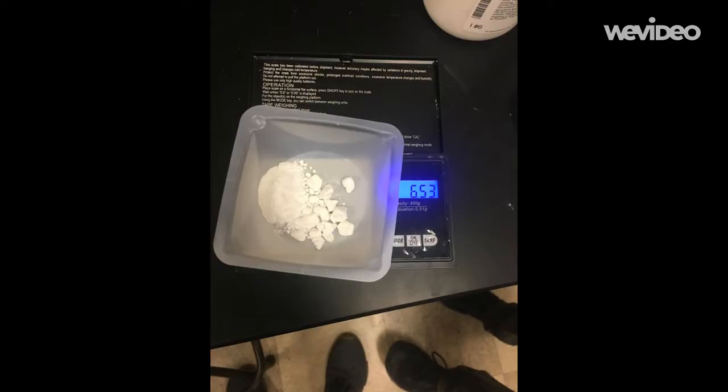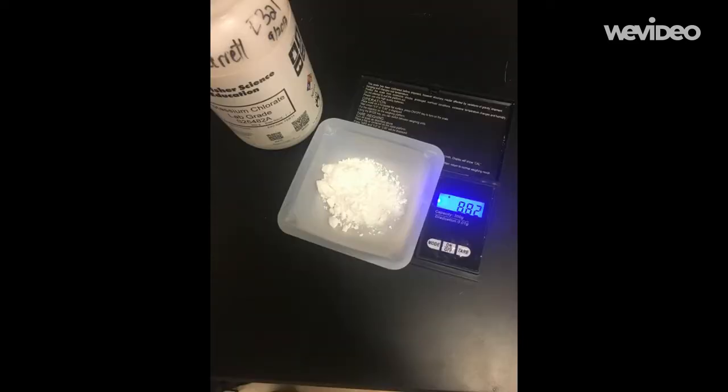So how exactly are we going to blow the gummy bears up? Well, the first step is to weigh the correct amount of sodium or potassium chlorate using stoichiometry. Chemical equations we'll be using will be shown later, but it's really just simple stoichiometry to get the chlorate sample in excess.